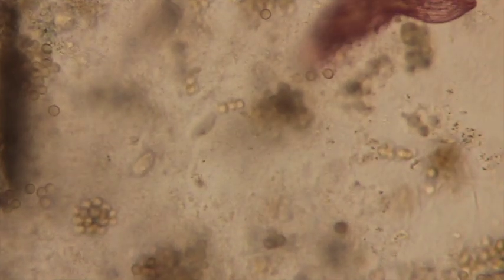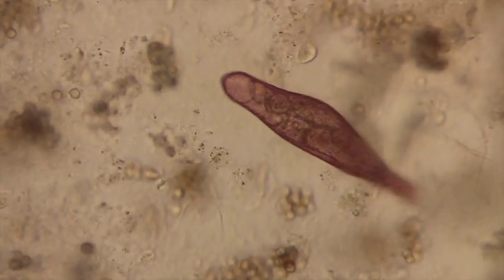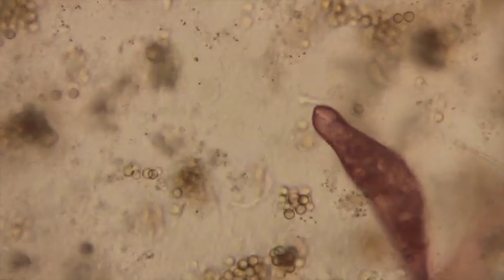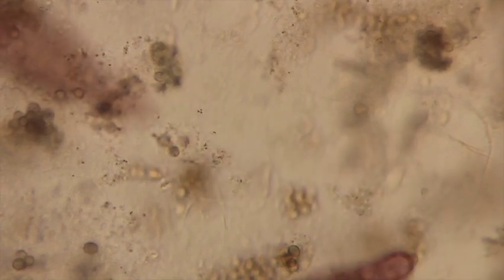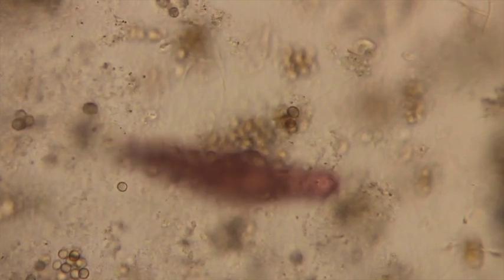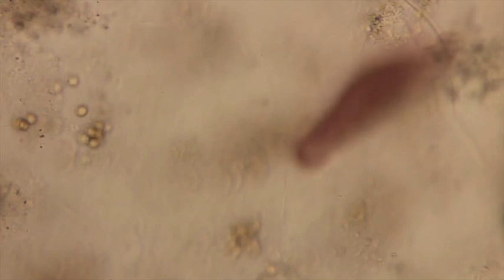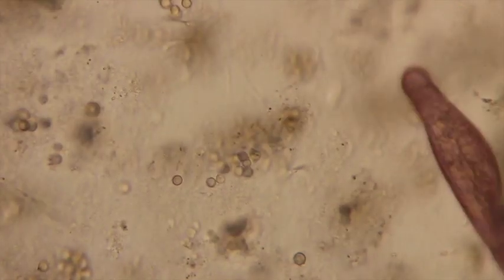40x on this guy so that we can see him in more detail. Okay, we can see that guy. He has cilia all around. Cilia then are teeny tiny hairs. The key thing about cilia is they beat synchronously. And by beating synchronously, then these guys can have the cilia all around their mouth region. So kind of on the left-hand side, this guy has a nice little mouth region that we can go in and you can see.